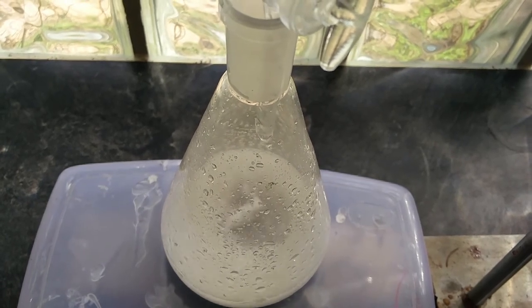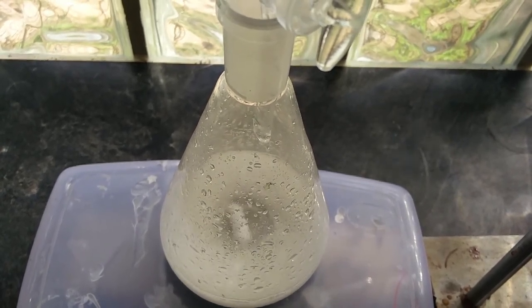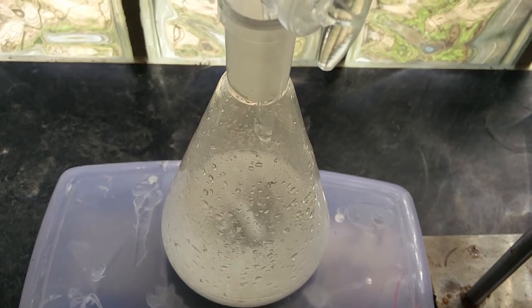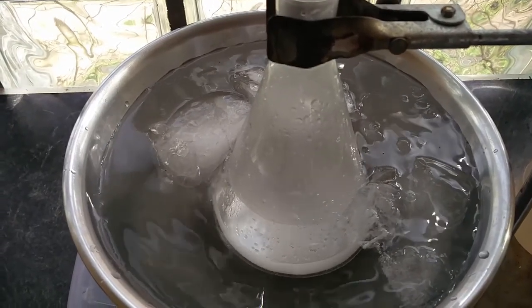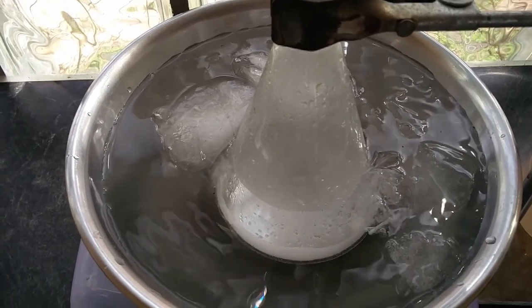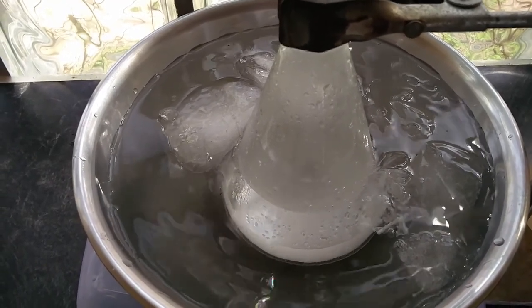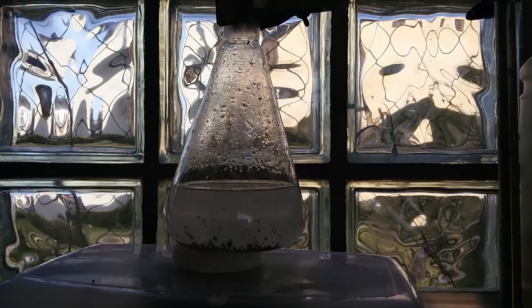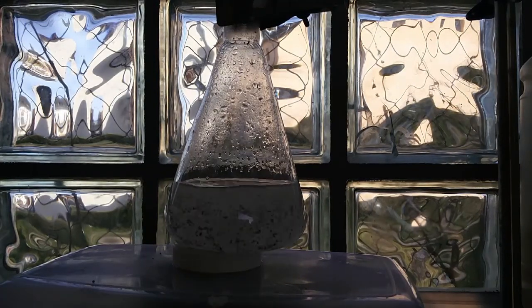After some time the reaction became quite warm and there were yellow fumes of nitrogen oxides, so I used an ice bath to cool it down. When all the acetic acid is mixed in you should stir it for another 15 minutes.